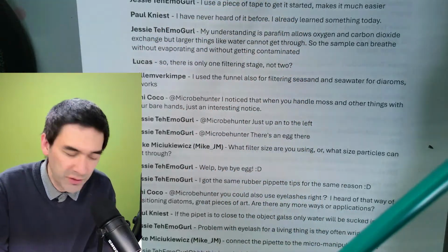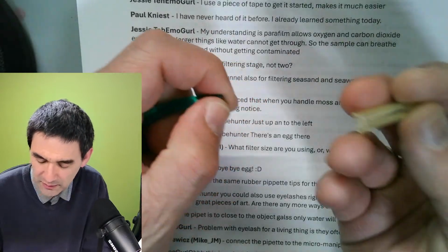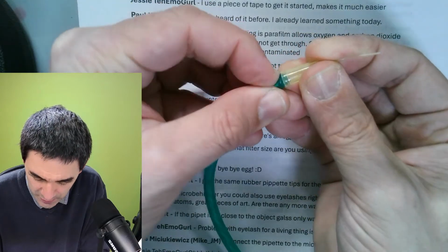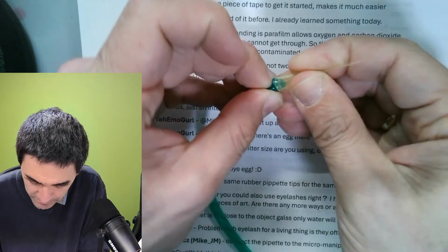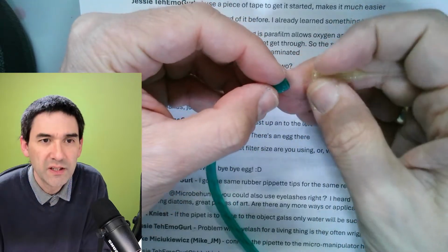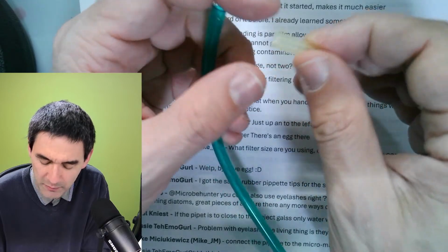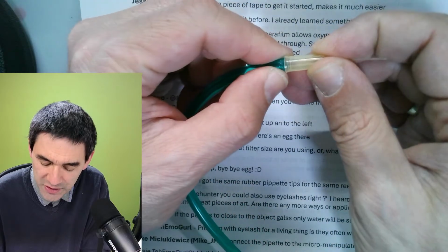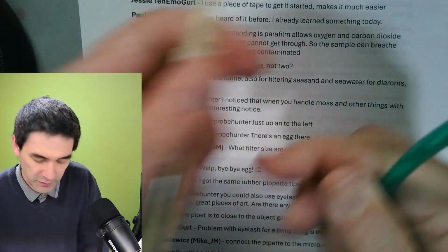I'm just going to show this to you on the other end here. What I've done is I try to squeeze it in here somehow, and then I have wrapped some parafilm around it. I cannot do that now, but you get the idea. So this is basically how I've done this. I pushed it in here, or you can warm it up over the flame and make it a little bit softer, then it goes in better, and then parafilm to make it airtight. And this is what I have done over here.